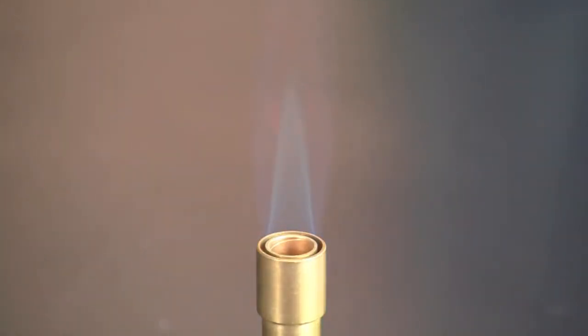The coolest flame is yellow and orange. A medium flame is blue and the hottest flame is a roaring blue flame characterized by a clear blue cone in the middle. The tip of the cone is the hottest part of the flame.